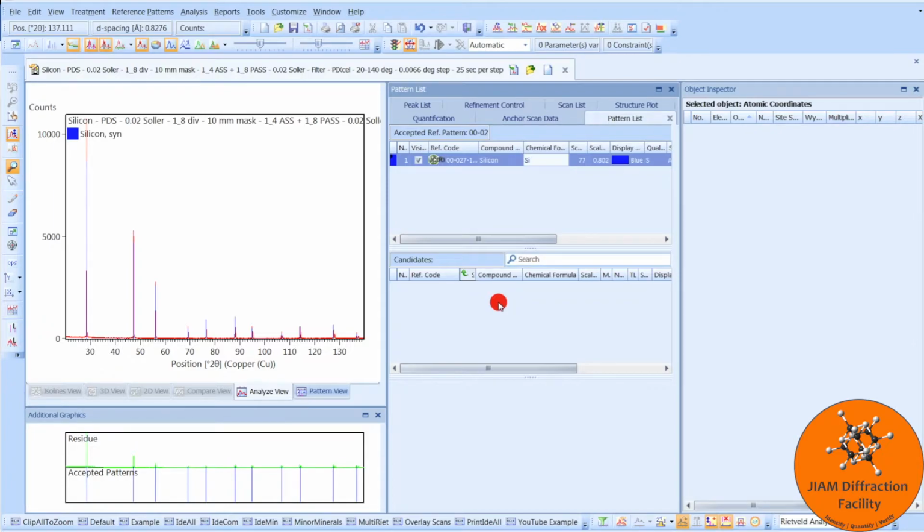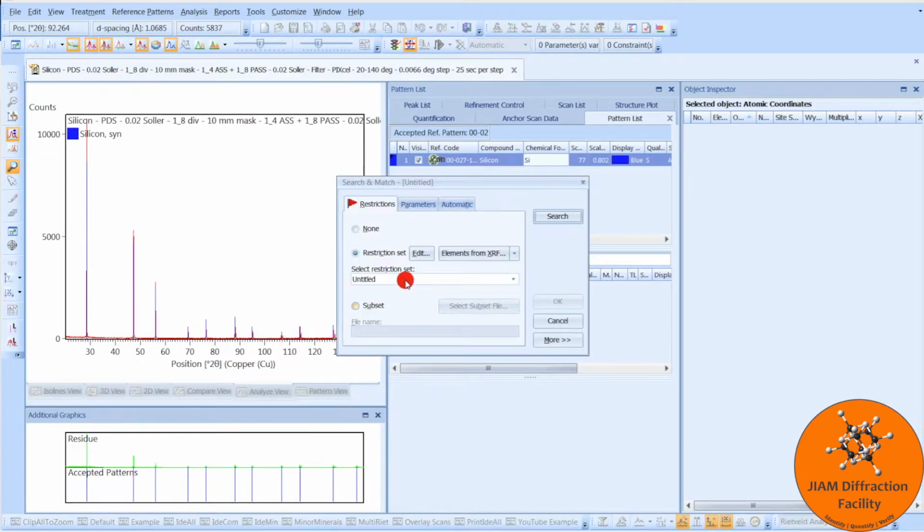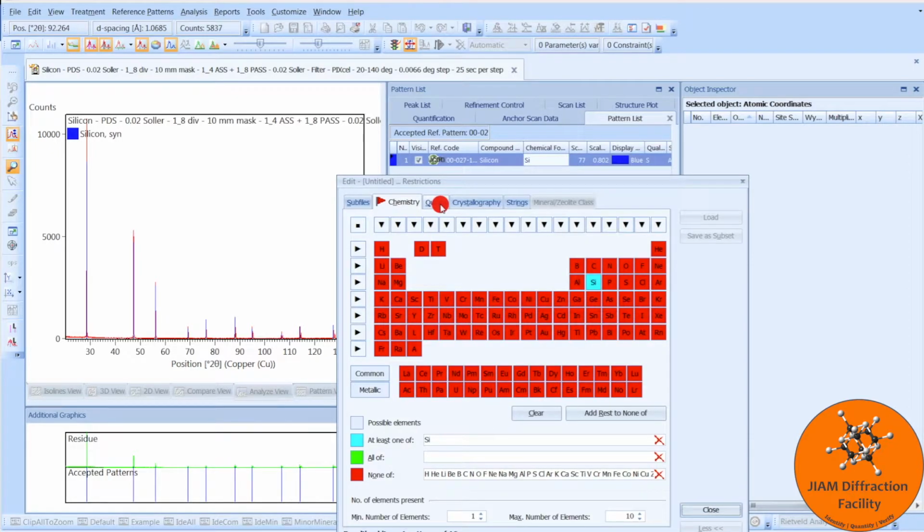Now, I don't have any other files on this computer because this computer does not have a database installed on it. The computers in the lab do, but this one doesn't. Yours might have many, many options for, say, silicon or whatever your phase is. Now, instead of clicking through each one in order to find one that does have atomic coordinate information, you could instead come over here, right-click, search match, edit the restriction set again, but this time go to the quality tab.